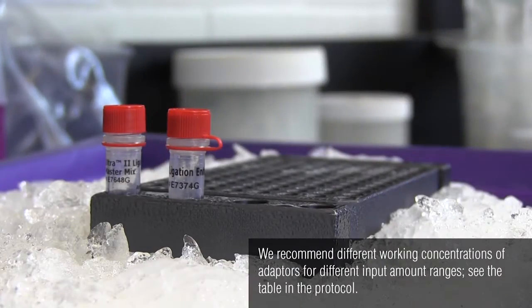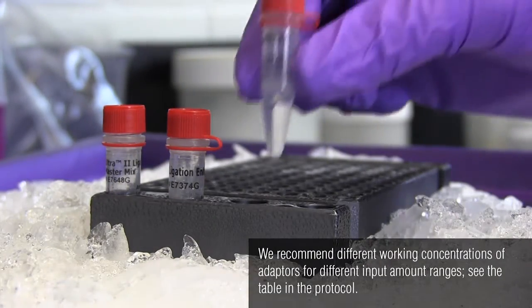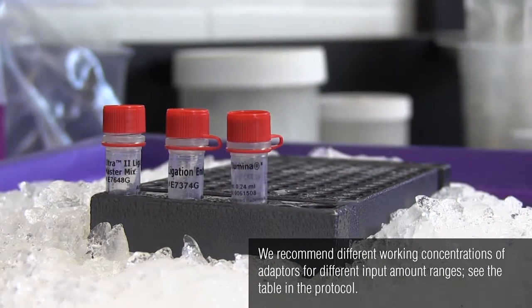The reagents used in this step are the Ultra 2 ligation master mix, the ligation enhancer, and the adapter, which are in the red capped vials.